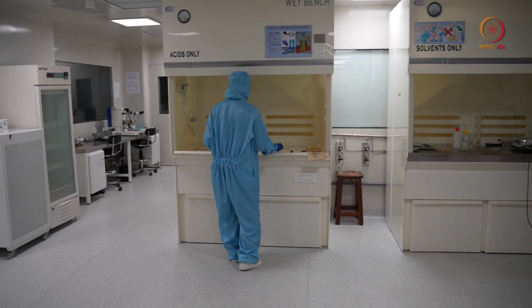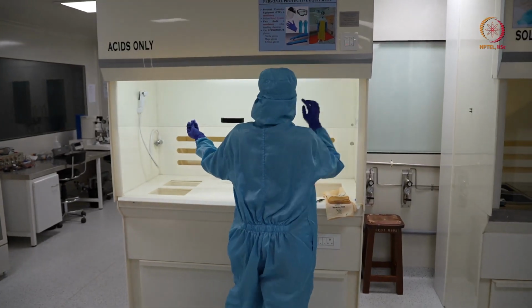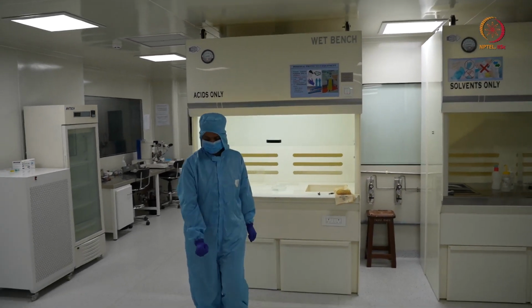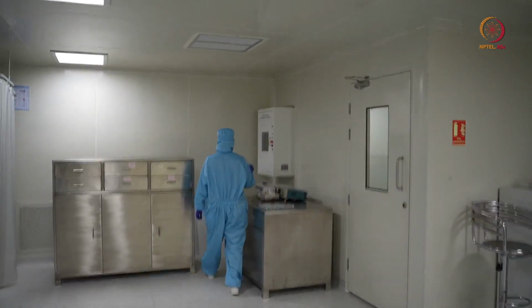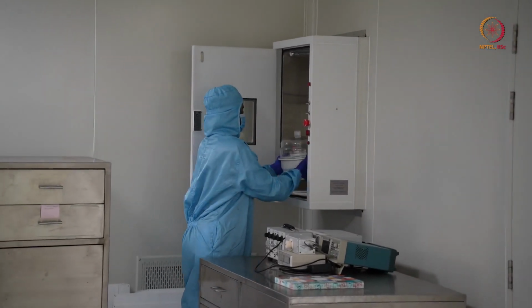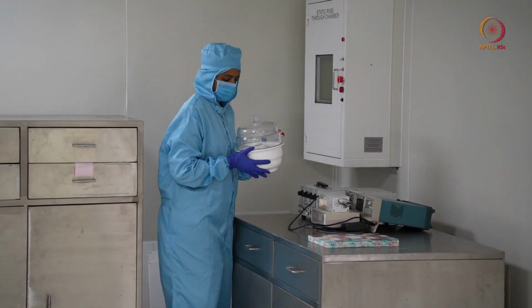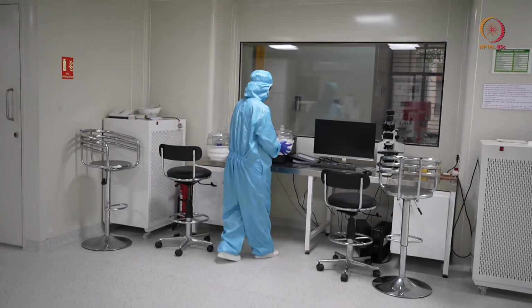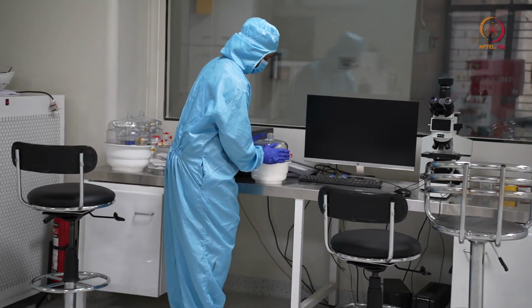As she entered the clean room, we can see that she directly went to the acid bench. She just switched on the light and suction for that hood, and then she will take the sample that she kept in pass box. So here she is opening the pass box to get the sample. She is taking that whole desiccator from there, close it again, and so she will now open the desiccator, and from there she is now taking the sample that she wants to process.